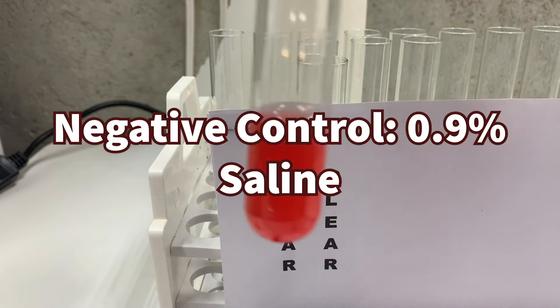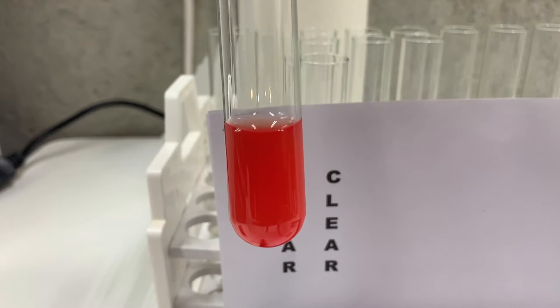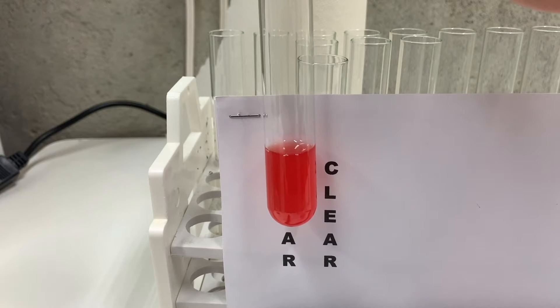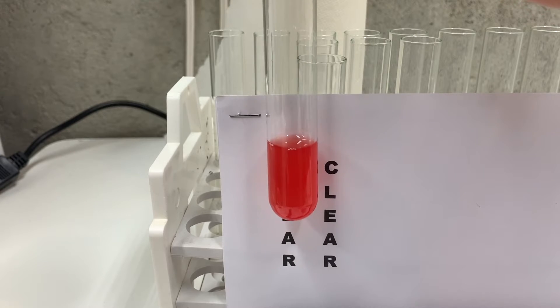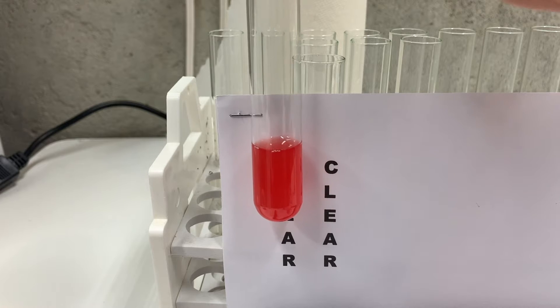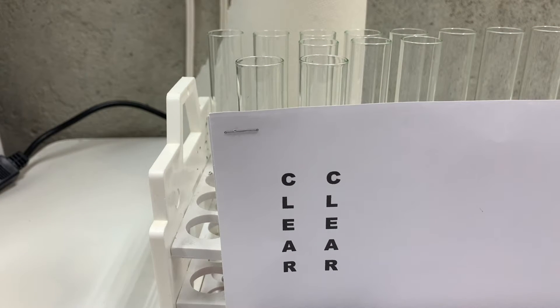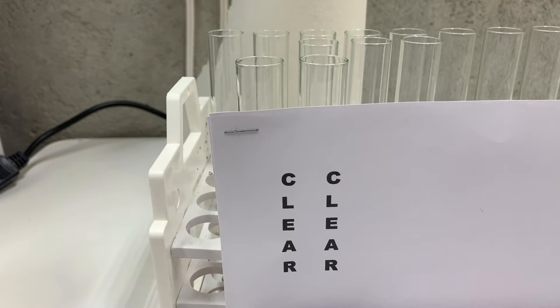I've added five mils of isoosmotic saline to this test tube, which had two mils of blood in it. As you can see, putting this against the letters, the solution is still turbid — the red blood cells are still intact and I cannot see the letters through that solution. This is my negative control; nothing's happening in this, so we can't see the letters. Next I'm going to do a positive control using water.